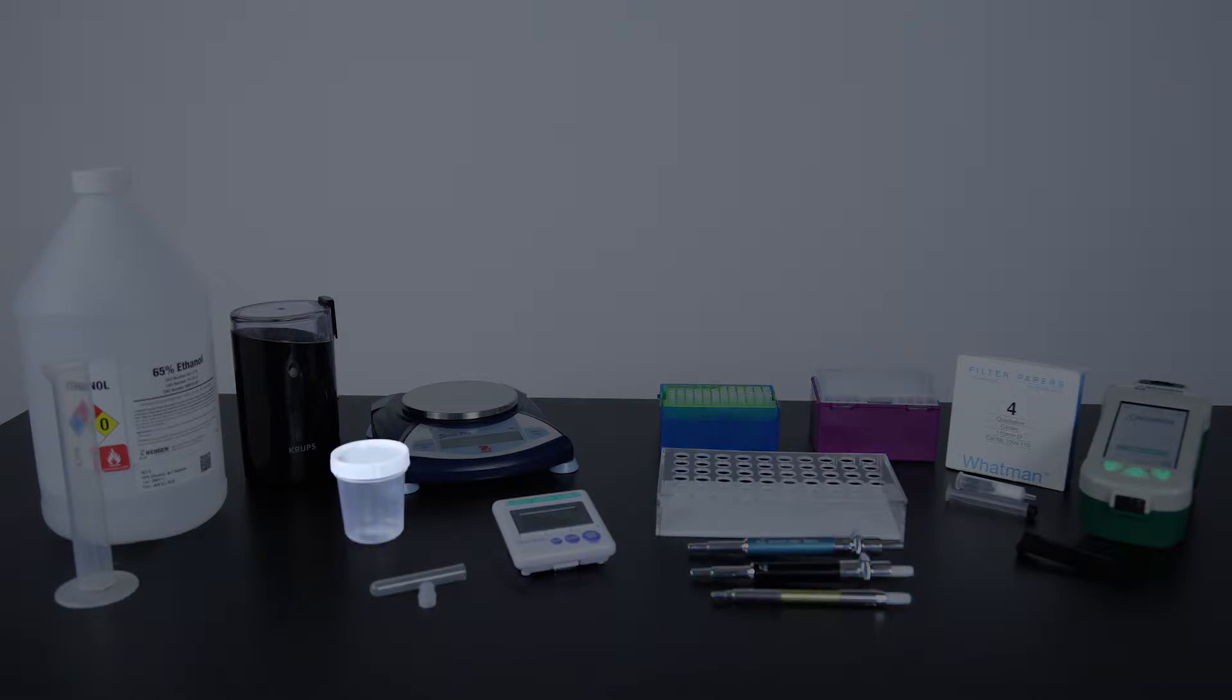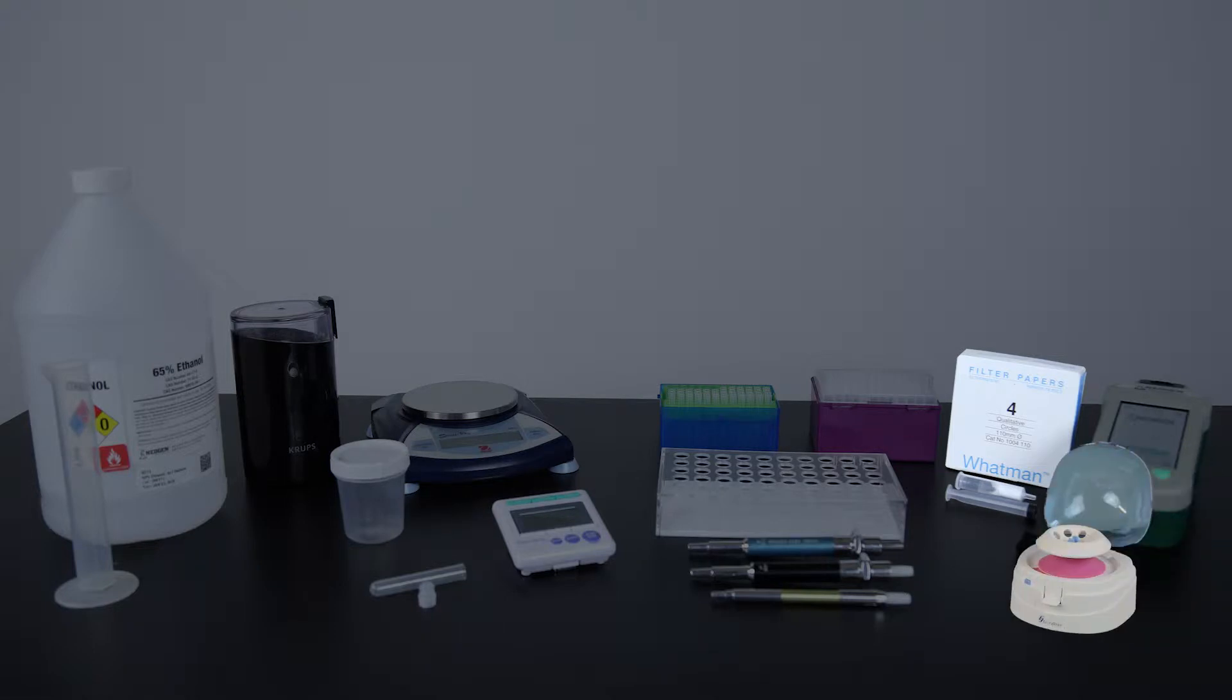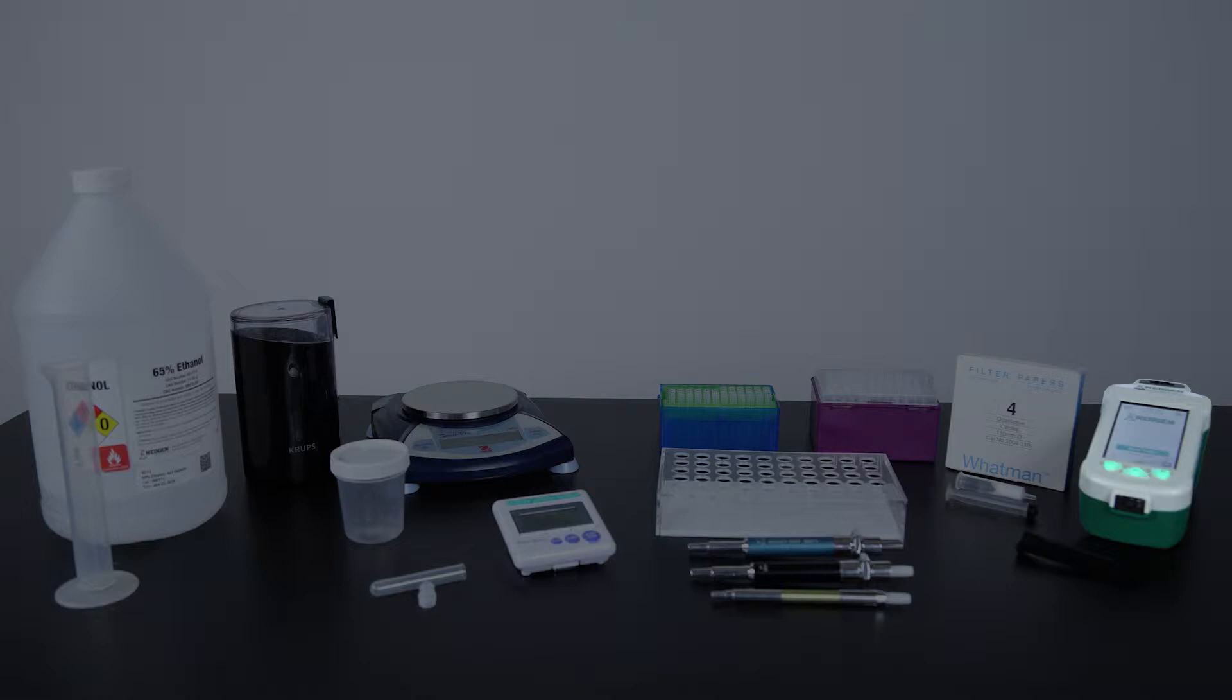Sample collection cups and lids, sample collection tubes and caps, filter syringes, Whatman No. 4 filter paper or mini centrifuge and tubes, a Raptor Solo integrated analysis system, and Raptor cartridges.